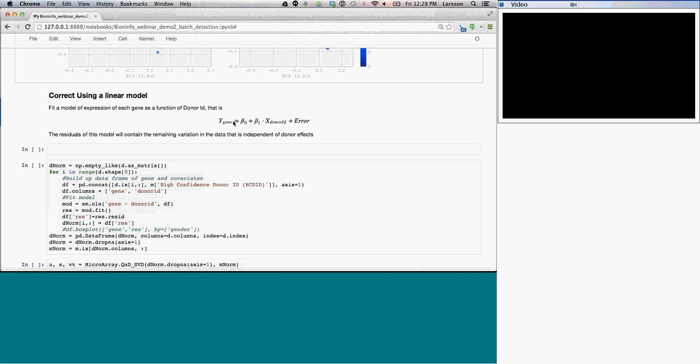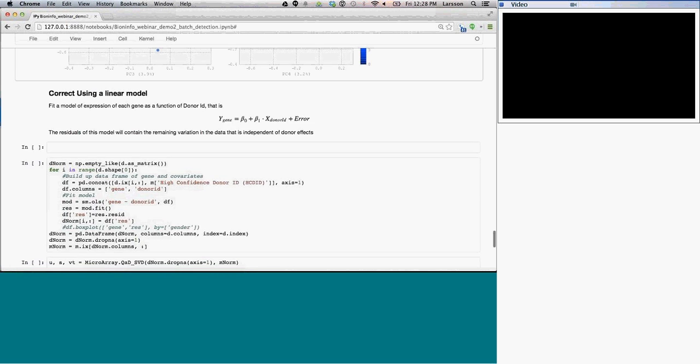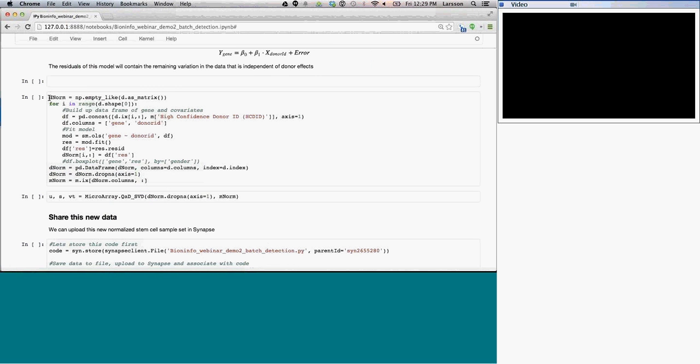And it'll basically tell you that you're trying to explain the gene expression based on this donor ID, and the error term is whatever is left over after you included the donor ID. And if we look at this error term, or the residual of this model, that will basically be the effect that is left over after you've corrected for donor ID. And what we do here is I'm going to create a new matrix, which are these residuals, and then I'm going to go through the range of all of the genes, and for each one of those, I'm going to build a model.